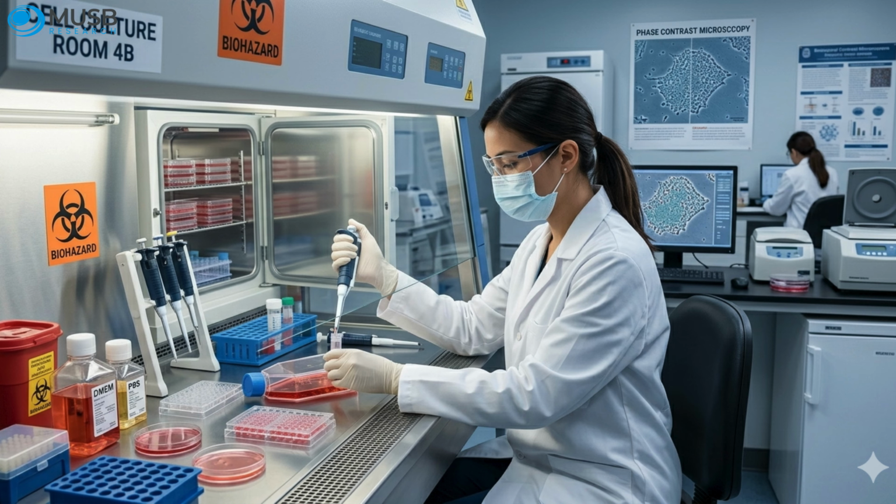When you sit down at the microscope, you are not just looking, you are systematically assessing 4 critical parameters. Think of yourself as a doctor doing a physical examination. You have a checklist, and each item on it tells you something specific about the state of your culture.